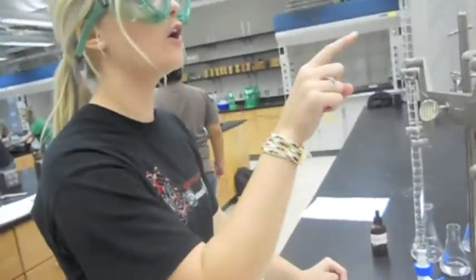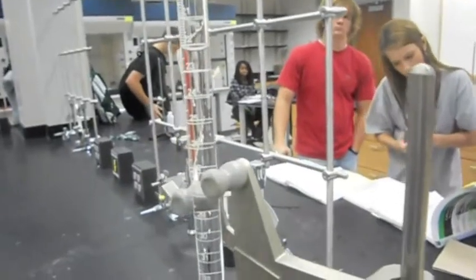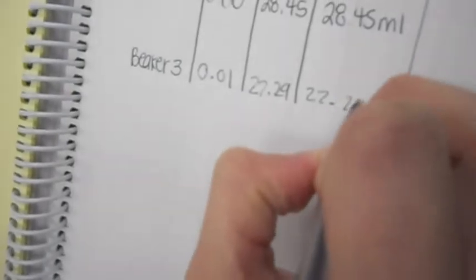And we just record the volume final, and it is 22.29. And then we're just going to subtract this, so our volume delivered is going to be 22.28.